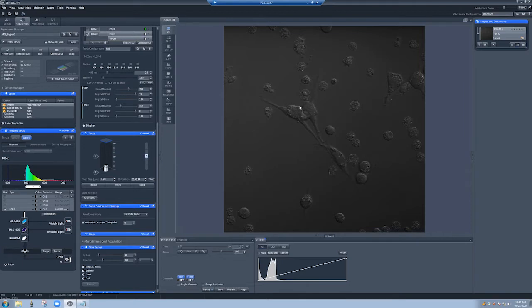Now, this will help if there are drifts due to temperature. It won't do anything for you if the cells ball up or the cells move out of focus because they moved relative to the cover slip. However, if the cover slip and cells are moving together and the cover slip is moving relative to the objective because of thermal expansions or contractions, that's what this will allow you to compensate for. And so I've turned it on. Let's see how this works.